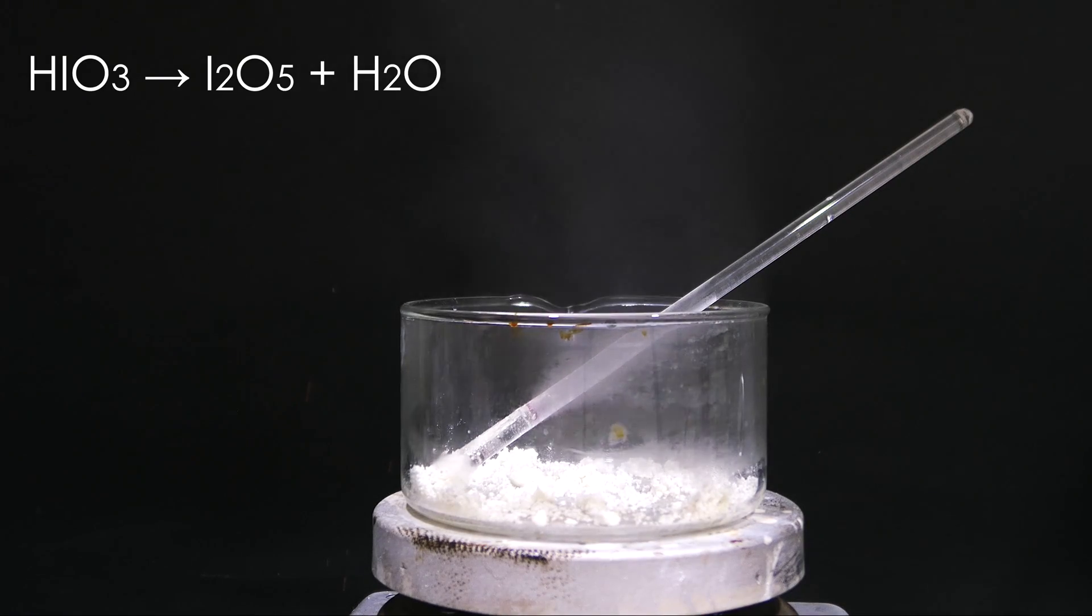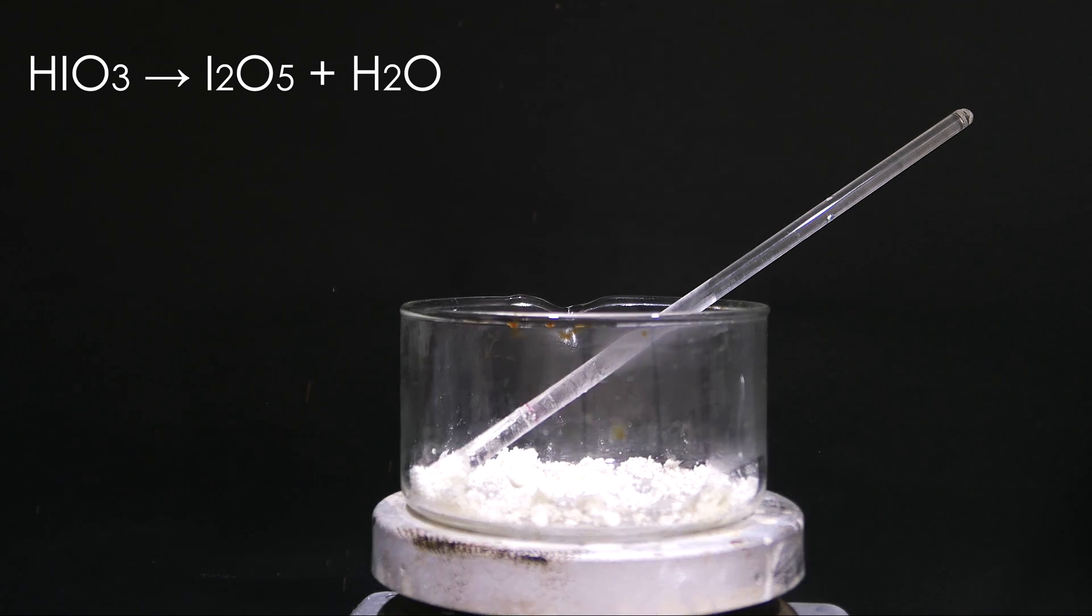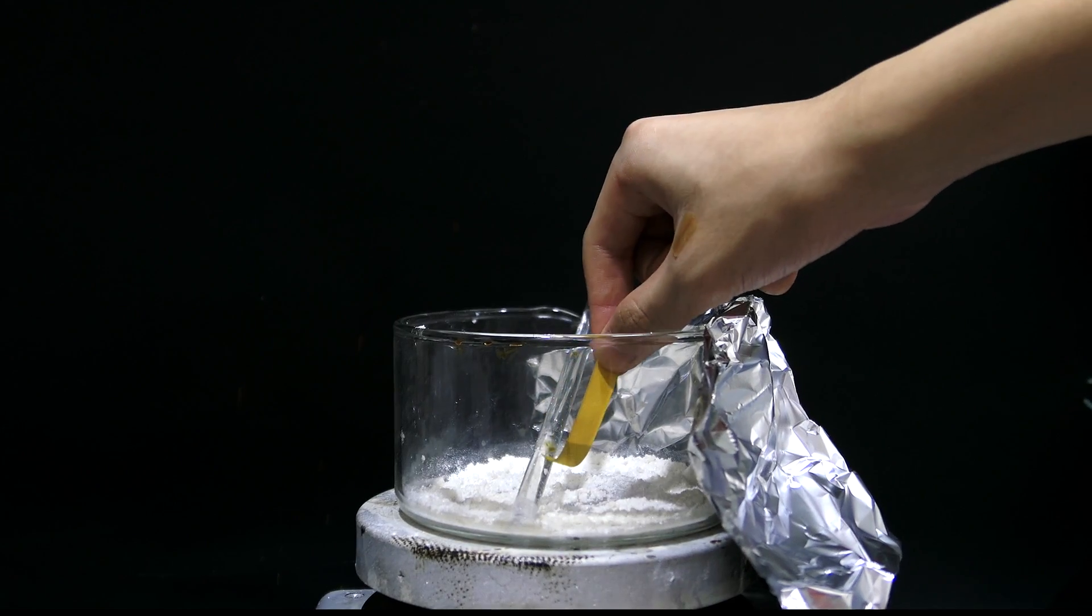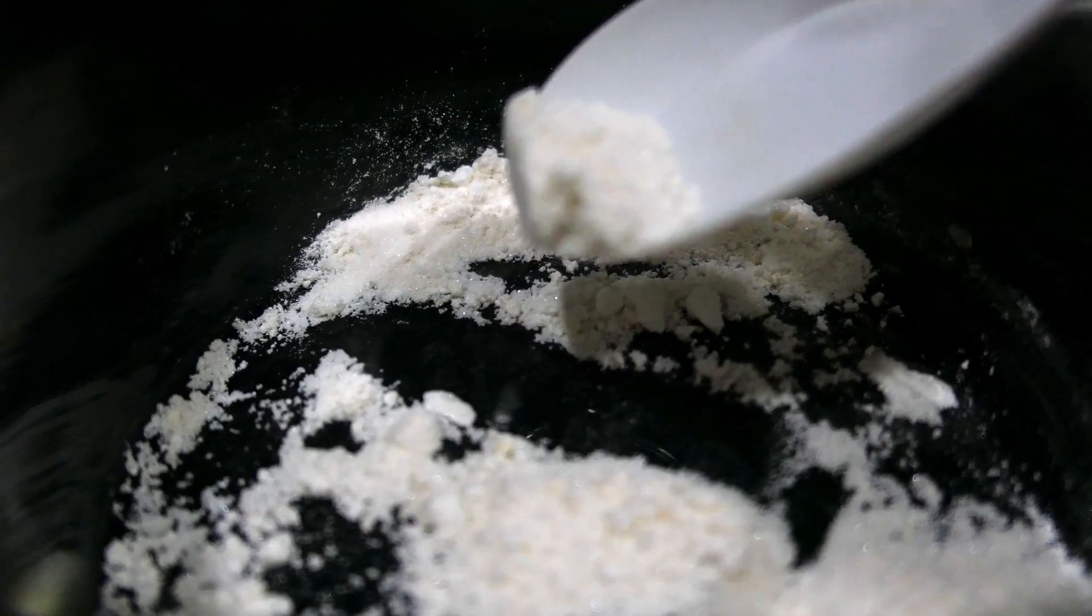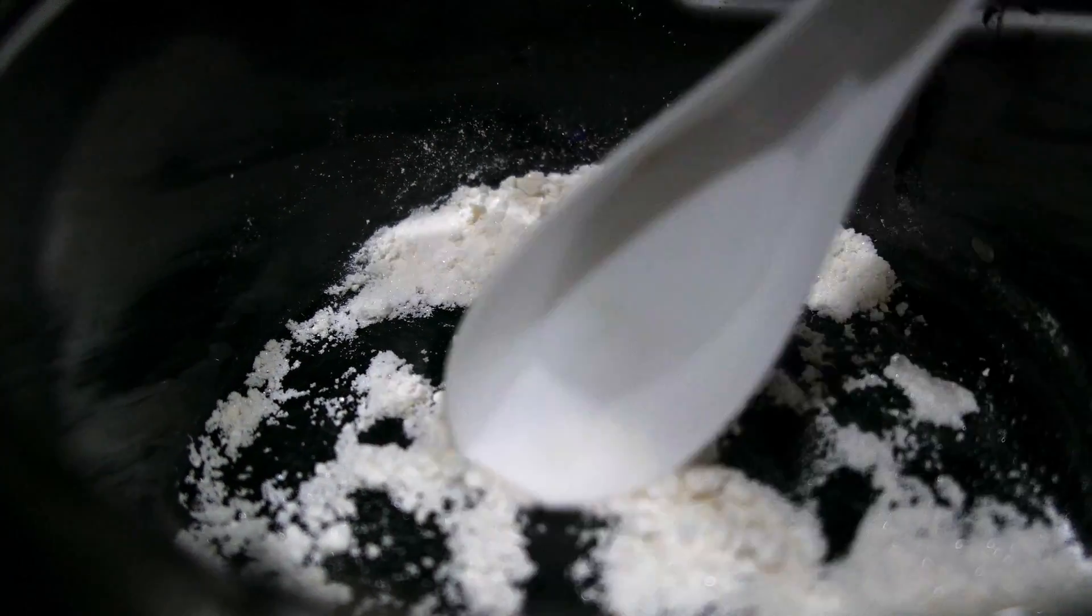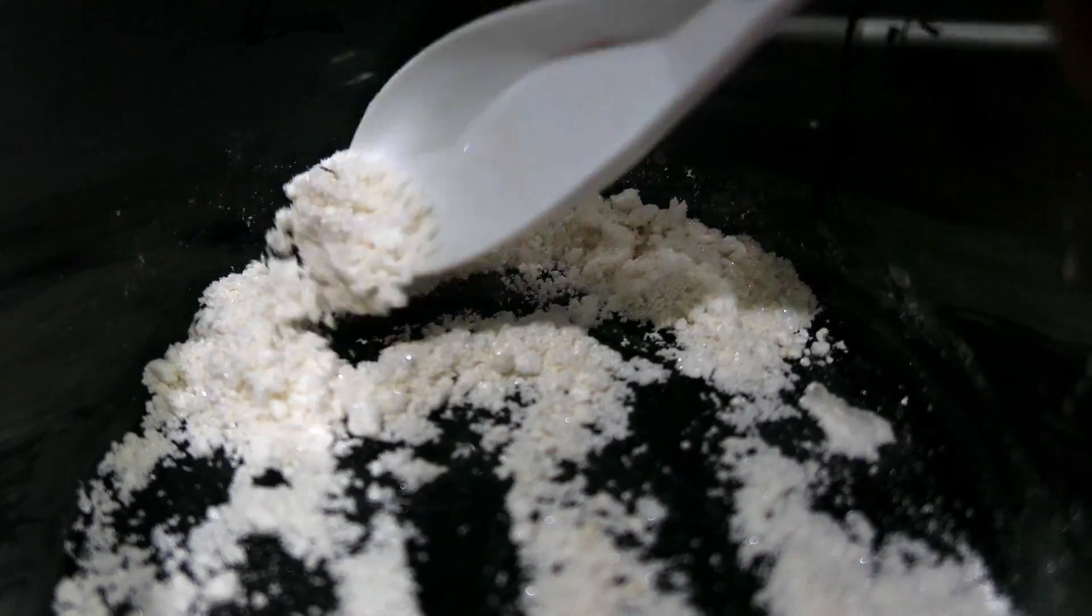A hot plate is turned to maximum heat. First, a lot of nitric acid will come off, so please do this in a well-ventilated area. The conversion is completed when it no longer emits acid vapor.